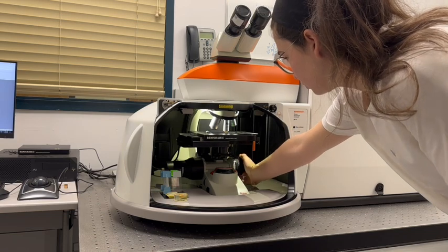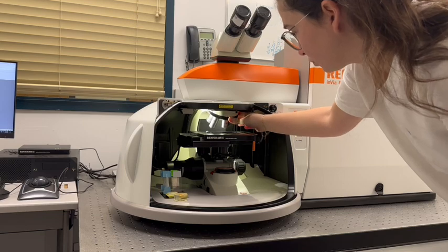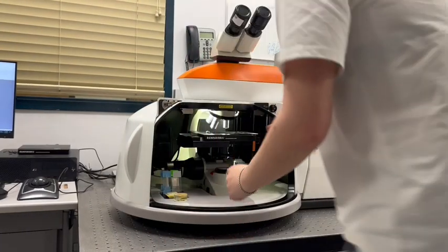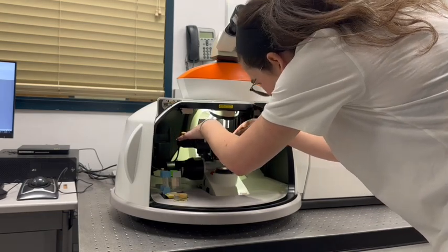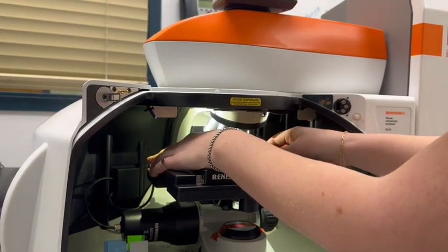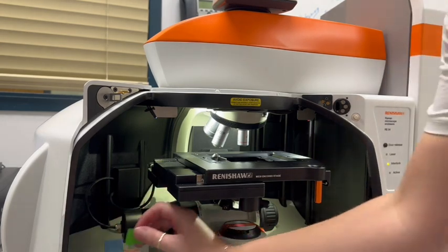Open up the microscope door and remove the copper sample. When removing samples, ensure that the objective lens is set to 5x so that you have the most working room to remove and place new samples. Ensure to change the software to be set to the ×5 microscope setting when using the ×5 microscope objective. Remove the copper sample and place your sample.